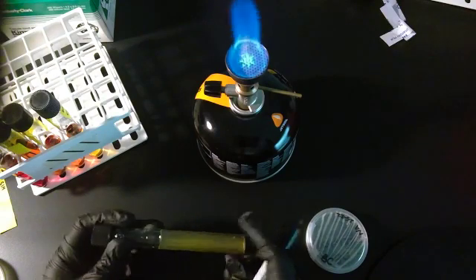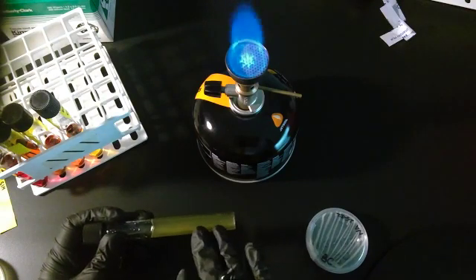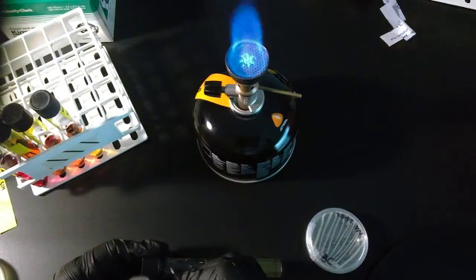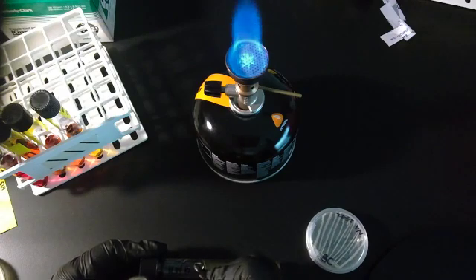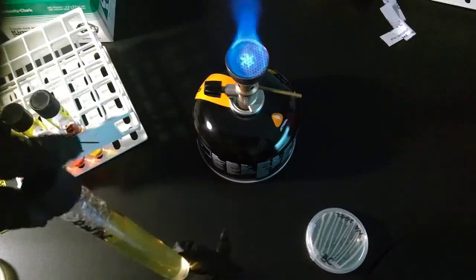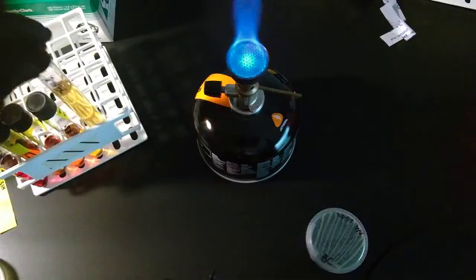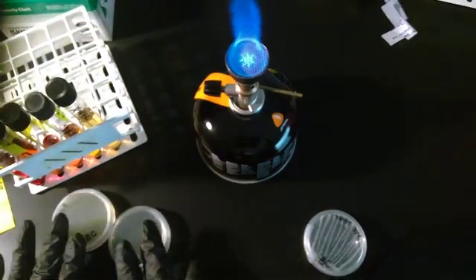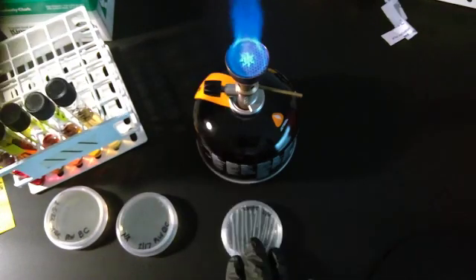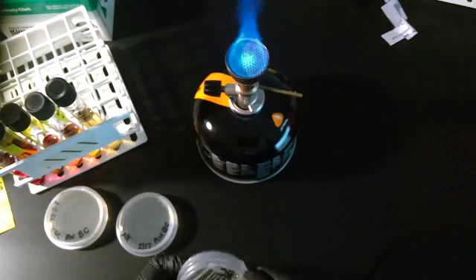So I don't want to have any writing or anything down here where that is. Instead, I'm going to write up here, above where that SIM is. We've got these labeled, we've got these labeled, and we've got our sample.